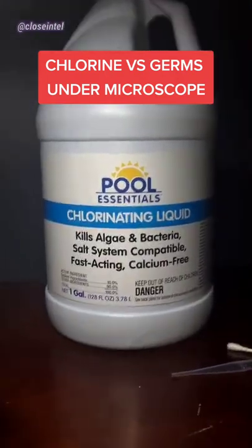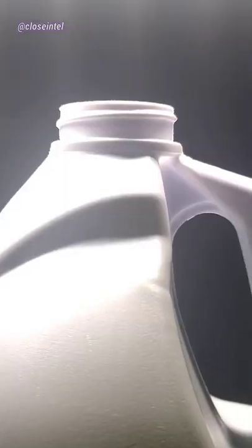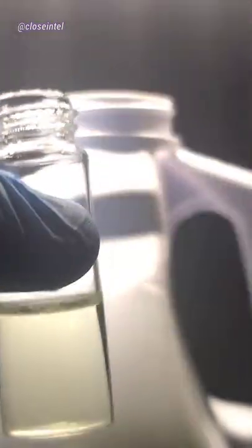Today I'm going to show you chlorine versus germs under the microscope. I initially just tried pouring the chlorine by itself, but it was too thick to mix evenly throughout the slide. I diluted it in some water for a 50-50 mixture.